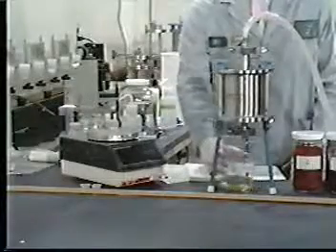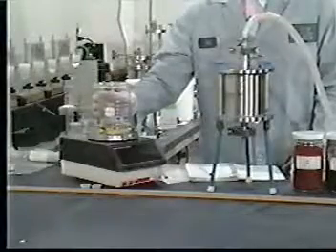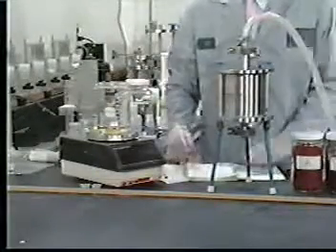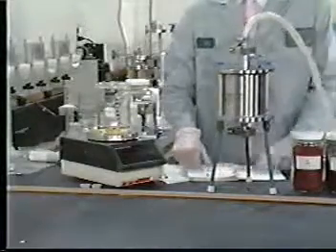The filtrate is collected in the pre-weighed beaker. That beaker is now weighed again to determine the amount of filtrate which has been produced. The weight of the solid is determined by subtracting the weight of the liquid from the total weight of the waste as recorded before filtration.